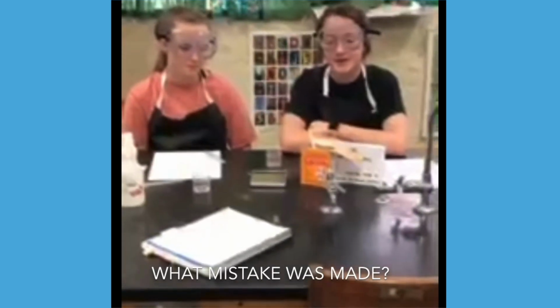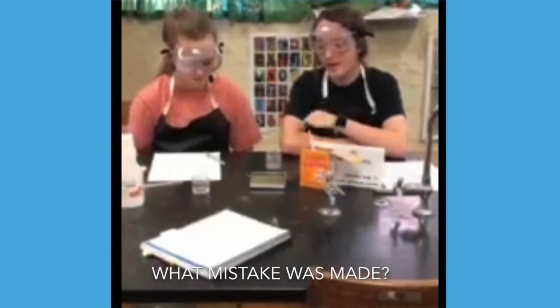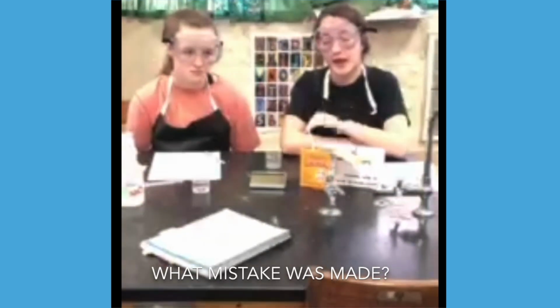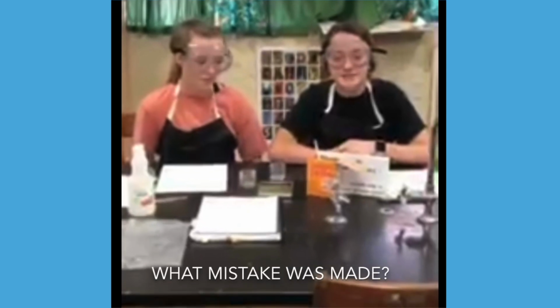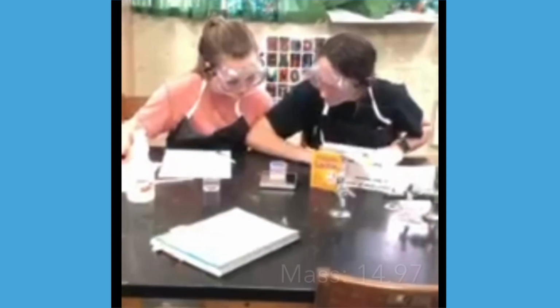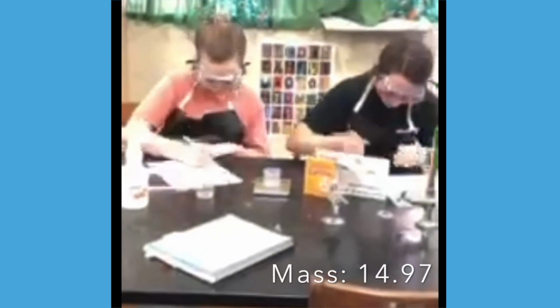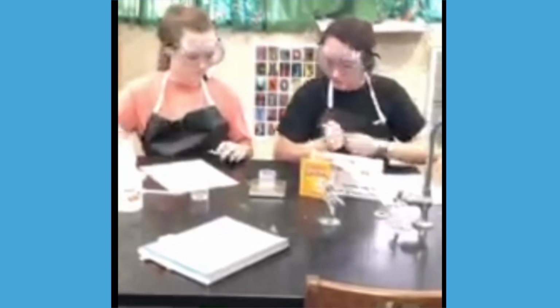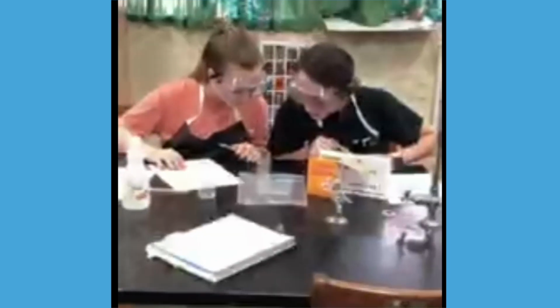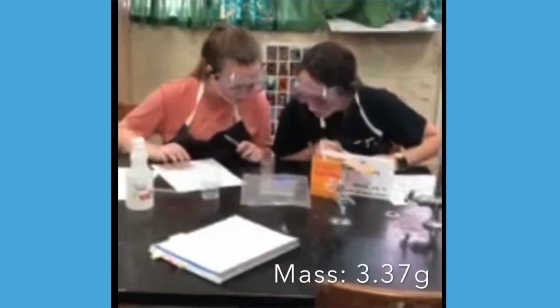We messed up because we forgot to weigh the cup and the bag before we added the solutions into it. Everything is measured in grams. 14.97. Okay, bag. 3.37.